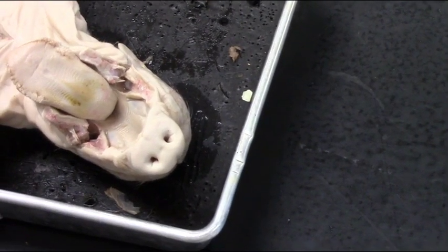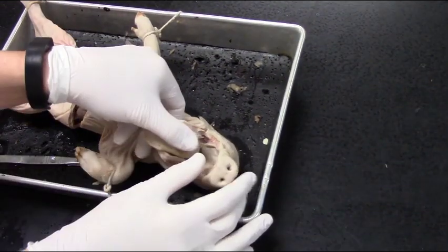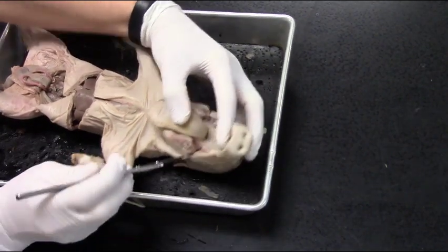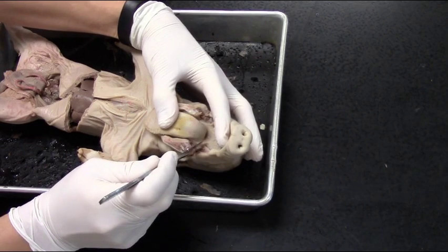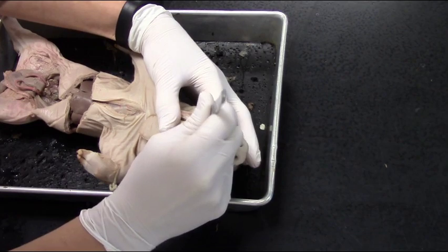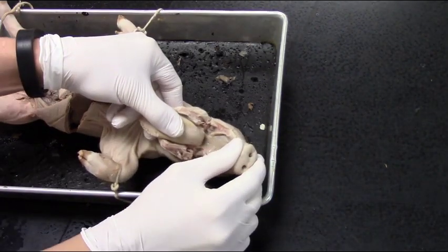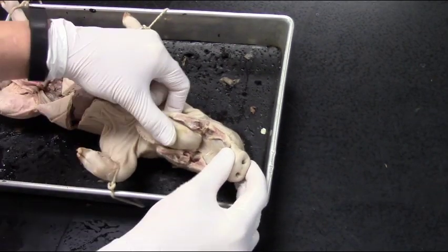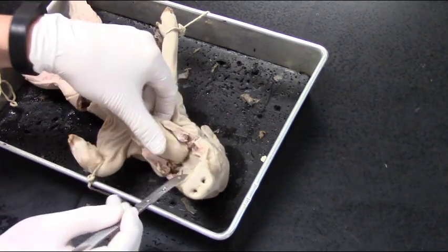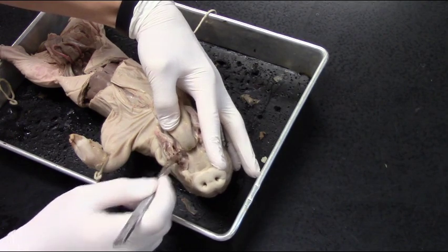You can see how I'm kind of opening up those sides—see the jawbone and some of the muscles that are being cut. I'm just pulling it gently to see if there's any give. I'm using the scalpel to make those gentle incisions on both sides.